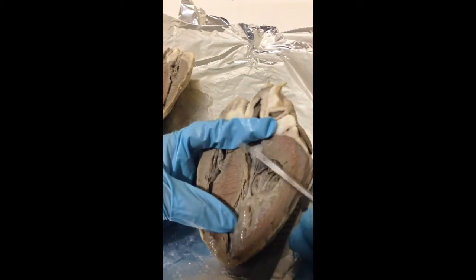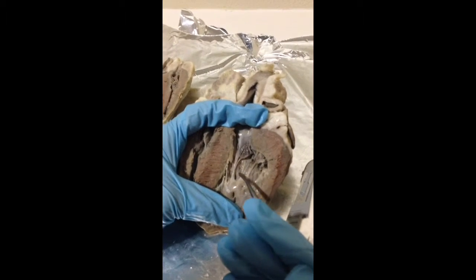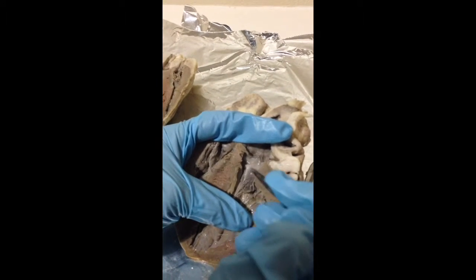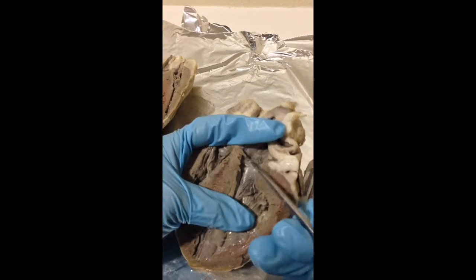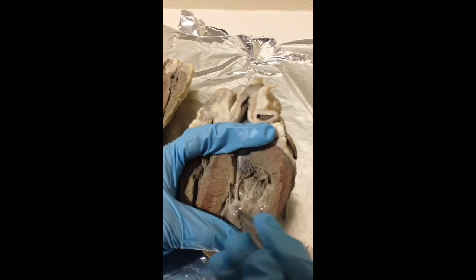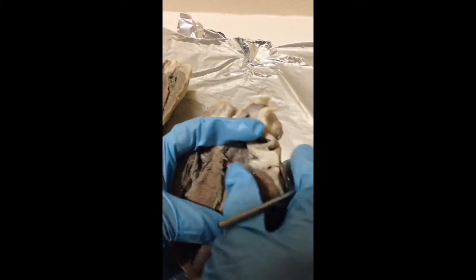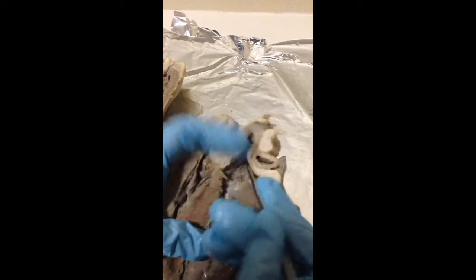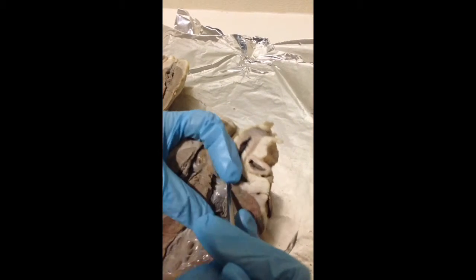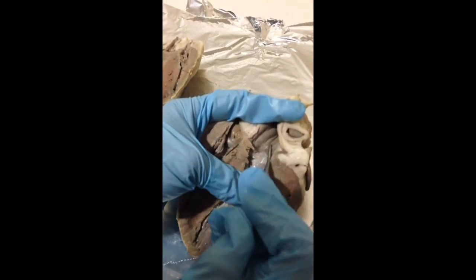The chordae tendineae are at the base of these valves, these little cord-like structures, and the cusps of the valves are found right at the base of the tricuspid and bicuspid valve. The papillary muscle is attached to the chordae tendineae, and the pulmonary semilunar valves are found at the base of the pulmonary trunk, right in this area, and the aortic semilunar valve is to the right of that, outside of the trunk, next to the bicuspid valve.